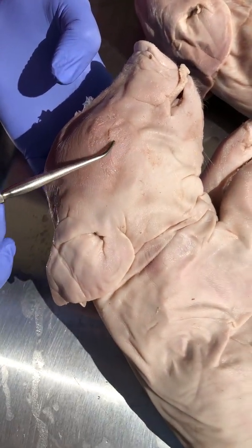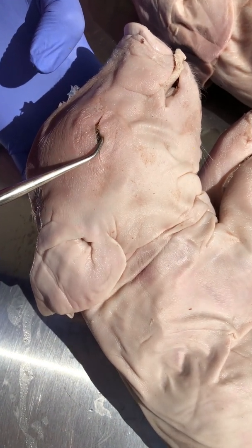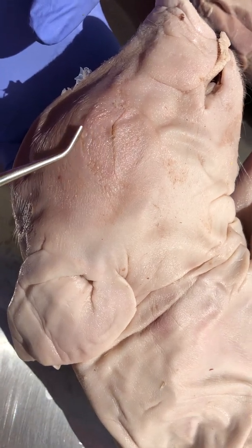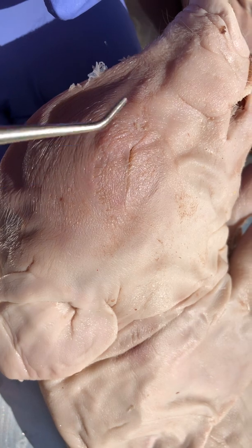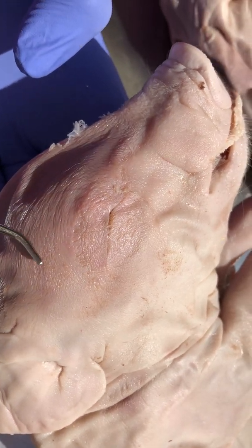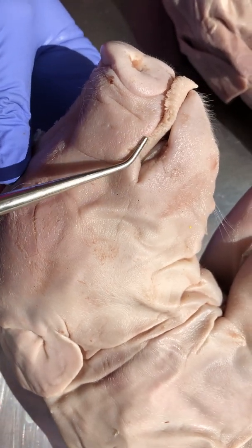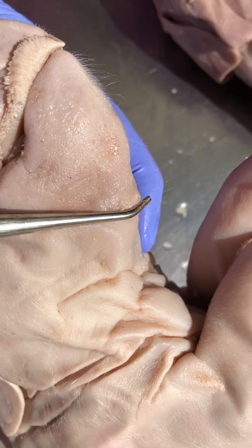Eyelids, upper and lower, and the eyes are closed. You may be able to see some hair specializations like eyebrows, and then just the hair coming in on the pig's head, as opposed to whiskers around the pig's mouth or the hair on its chinny chin chin.